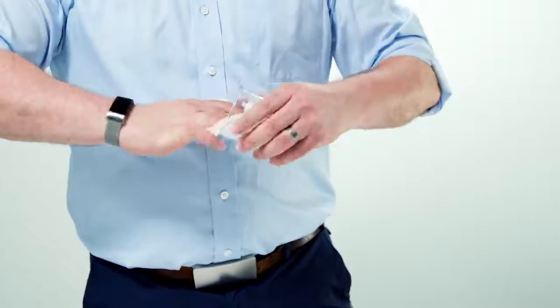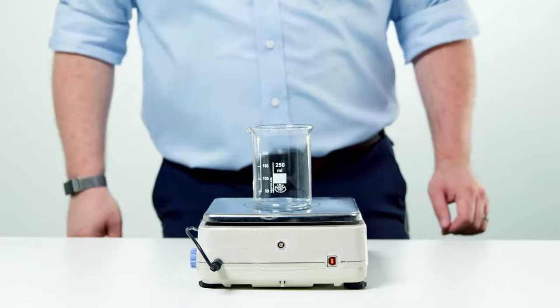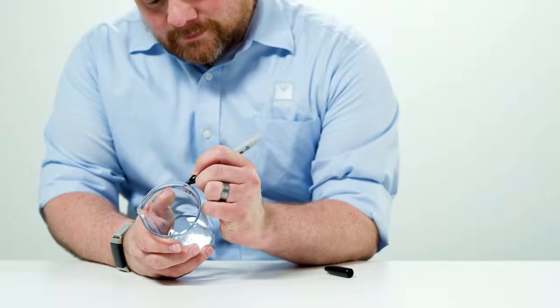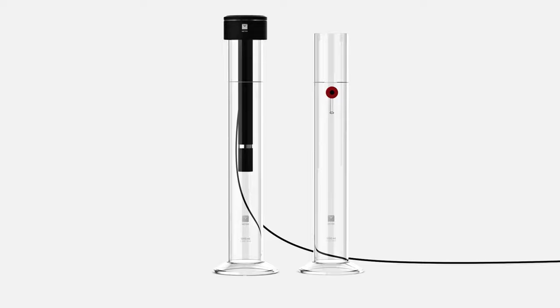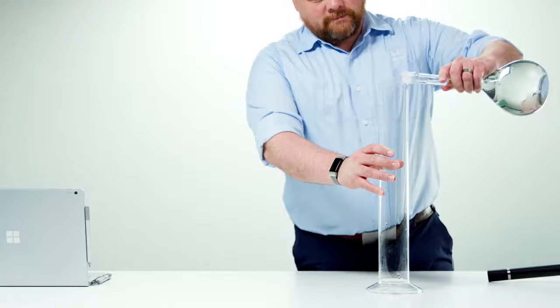Thoroughly clean and dry each beaker. Then weigh each beaker. Note the tare weight with an accuracy of 1/1000th of a gram. Prepare a label for each sample beaker with the respective sample name and beaker weight. If the surface material of a work table is extremely hard, for example stone, cover it with a thin rubber mat. This reduces the risk of damaging the glass PARIO cylinders and beakers.